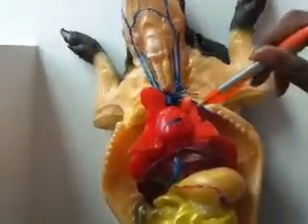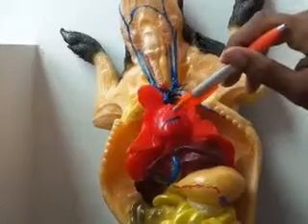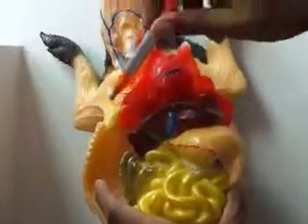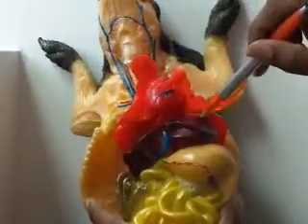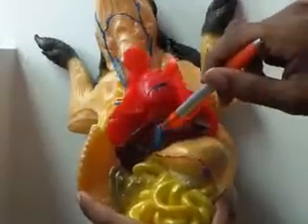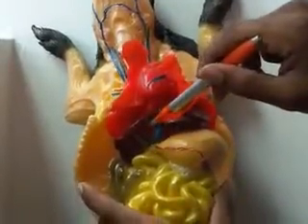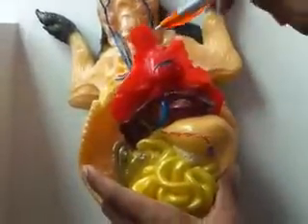Over here, you can clearly see the heart. You also have the lungs, the liver, the common bile duct, and this will be the inferior vena cava.